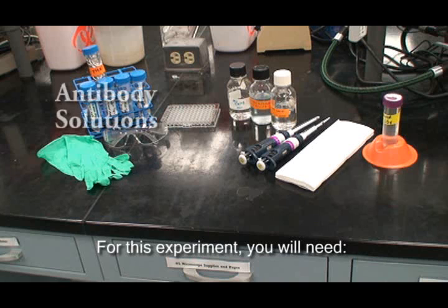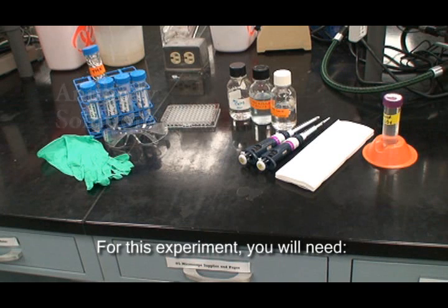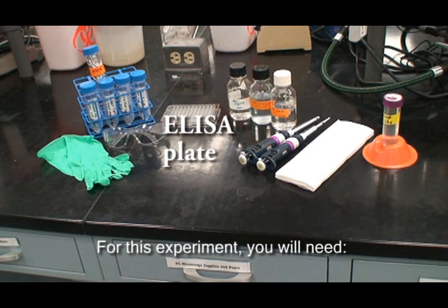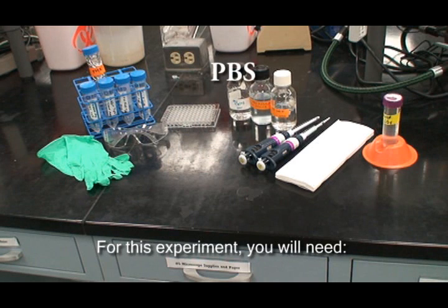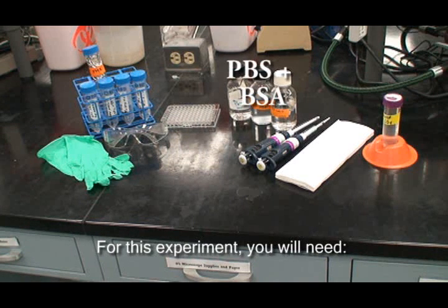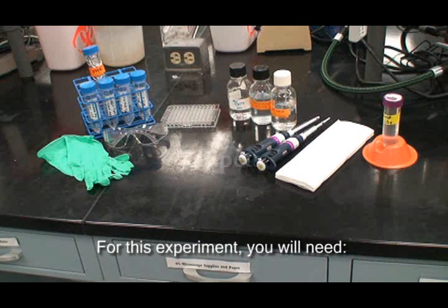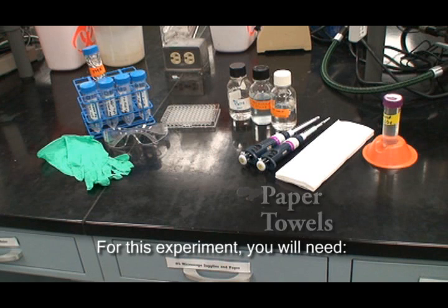antibody solutions, TMB, an ELISA plate, PBS, PBS-BSA, PBS-Tween, pipettes, paper towels, and sulfuric acid.